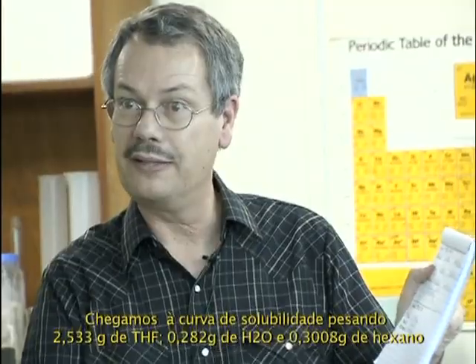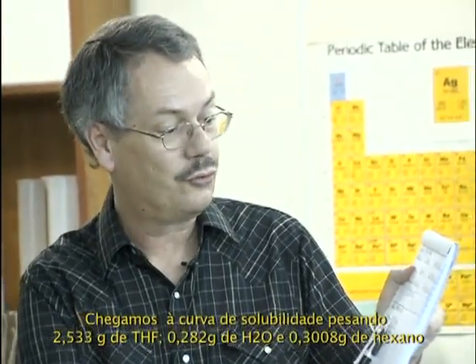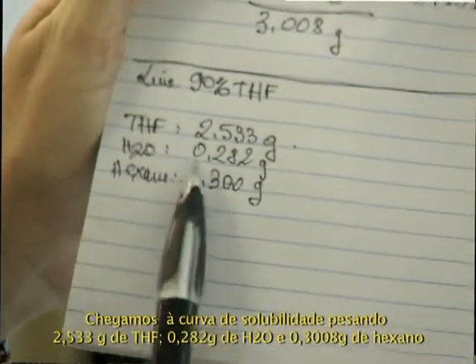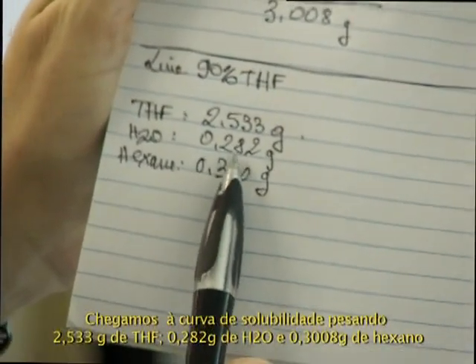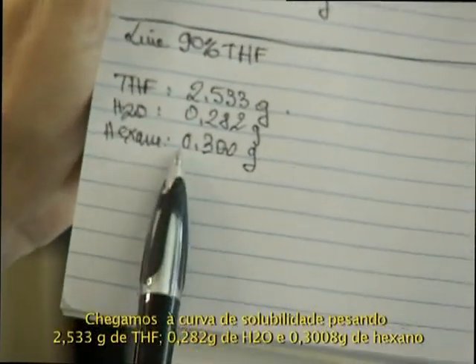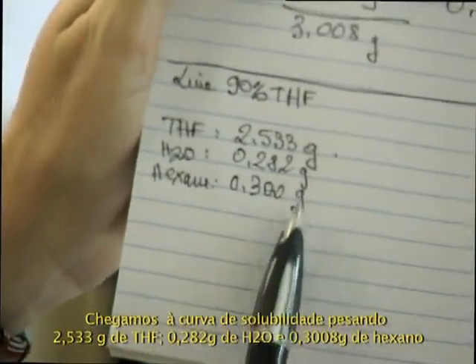So we got the binodal composition, weighing 2.533 grams of THF, 0.282 gram of water and 0.300 gram of hexane.